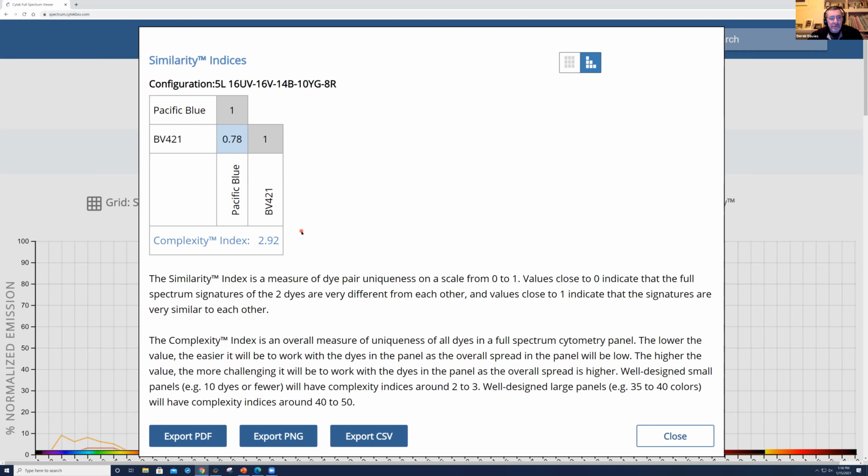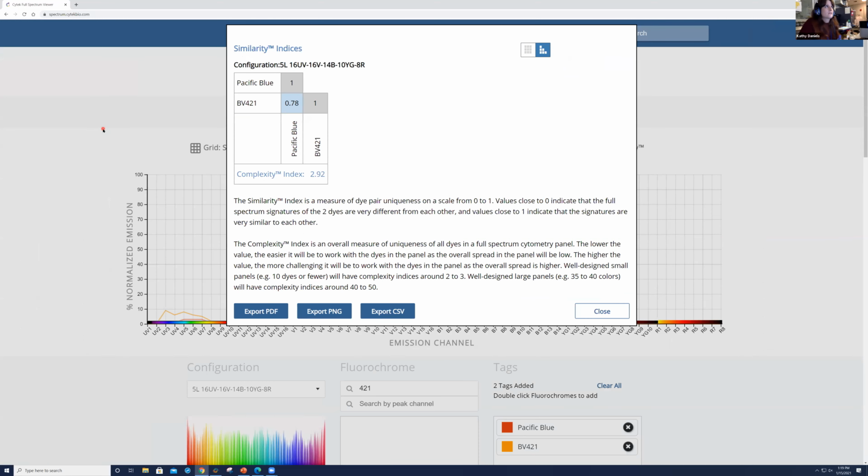I suppose with the traditional spectral viewers that you'd get from the bigger companies, you change the laser, don't you? And you look at the emission for that wavelength, whereas this is slightly different. Exactly. You're actually getting the whole spectrum in one graph, if you like. Exactly. Yep. And there are other options out there. I believe there might be fluorescent spectra viewers that mimic full spectrum by different vendors, specifically BioLegend, I believe, and I think someone just commented that also. But as far as the complexity and the similarity, I don't believe they have that, but I can be corrected if I'm wrong because I'm not certain. I probably should know this myself, but I wonder whether microscopy companies would have something similar. Potentially, yeah, potentially. Thank you, Derek.